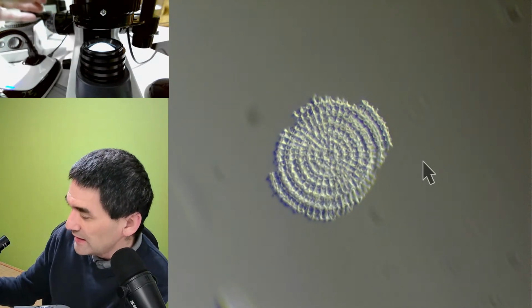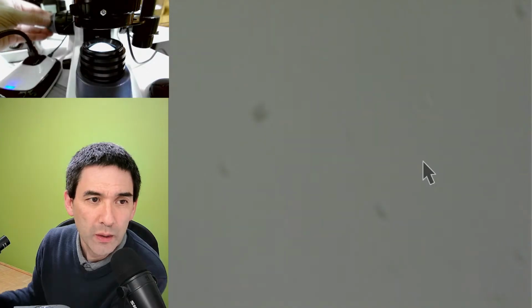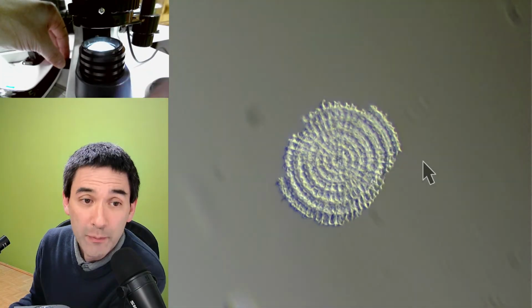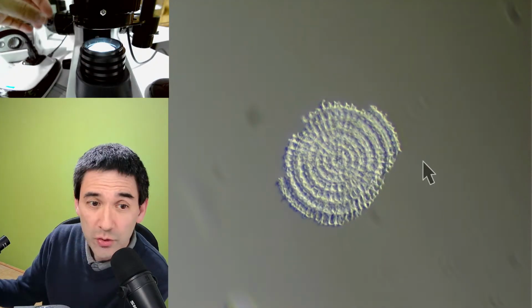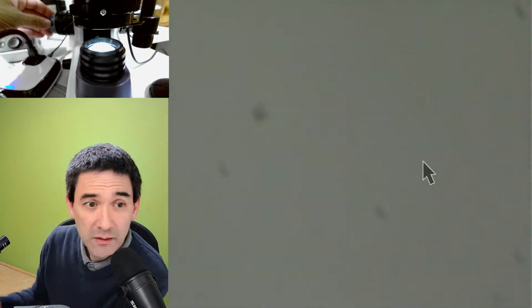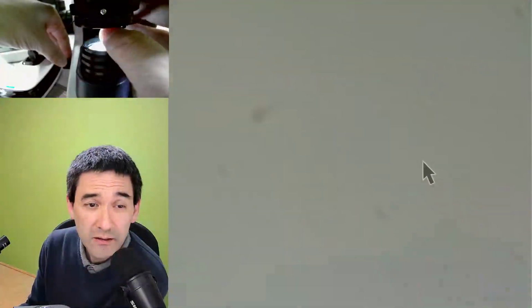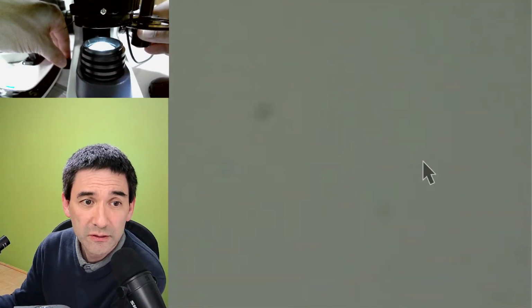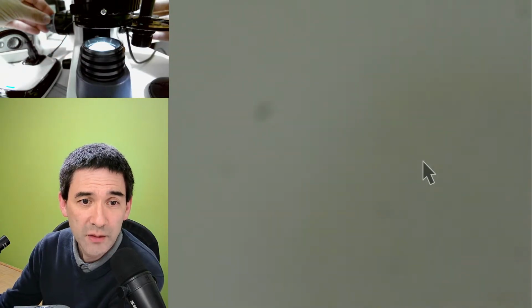And the interesting thing is that oblique illumination also works quite well at a lower magnification and at a higher magnification as well. Now I lost the focus a little bit. So let me see if I manage to find this. It's probably a little bit off center. Here we go.